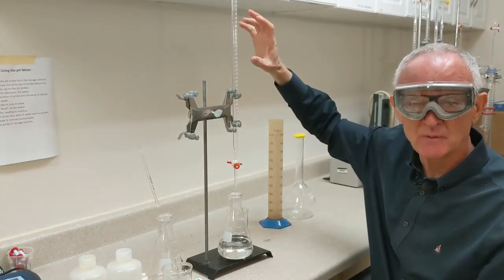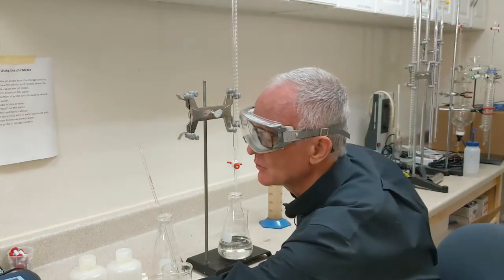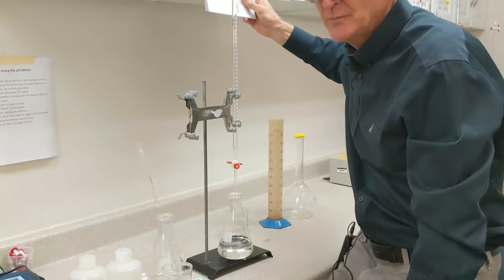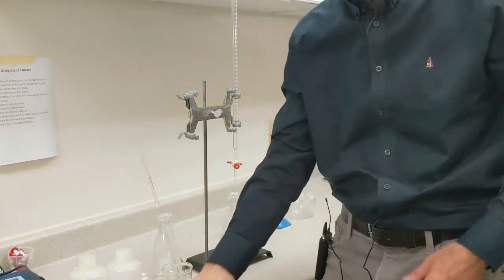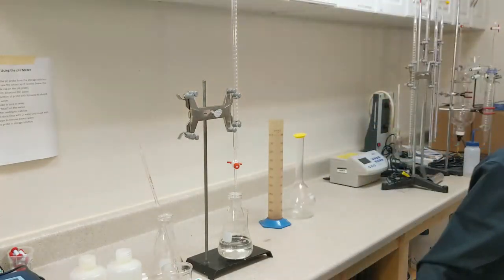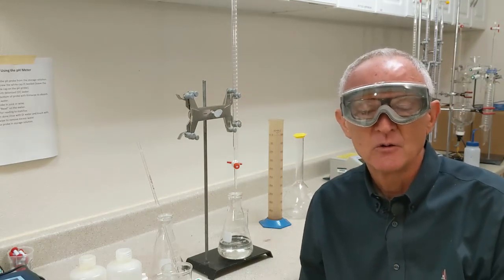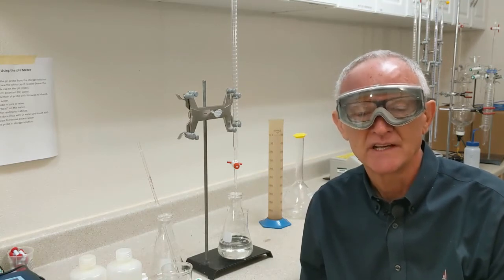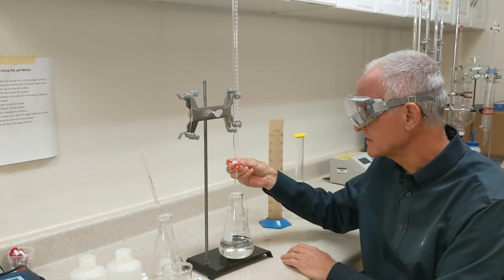Most important now is how much sodium hydroxide will I add to neutralize the acid in the wine. So I need to know my starting volume. And so an easy way to read a burette is have something white, put it behind your burette, and read the bottom of the meniscus. And I'm at 5.6 milliliters. And I'm reading from the top. Just make sure you have your reading in the right direction. And I always write that down. No matter if I'm doing just one assay, I often forget what that initial reading was.